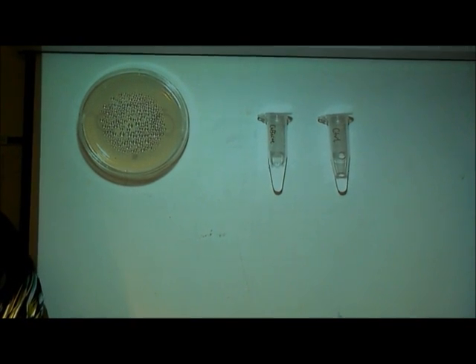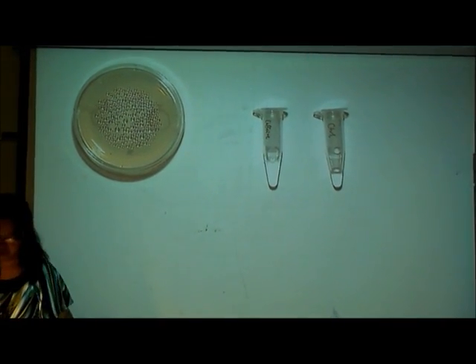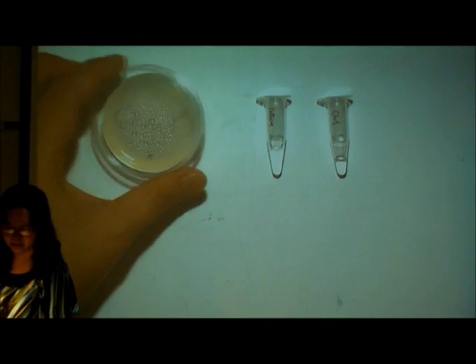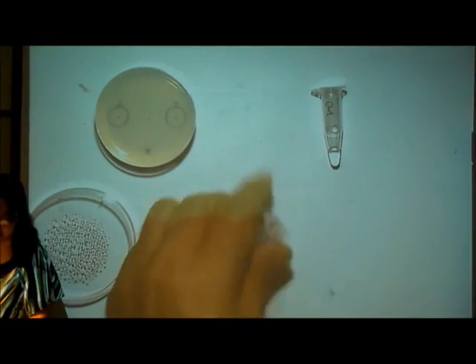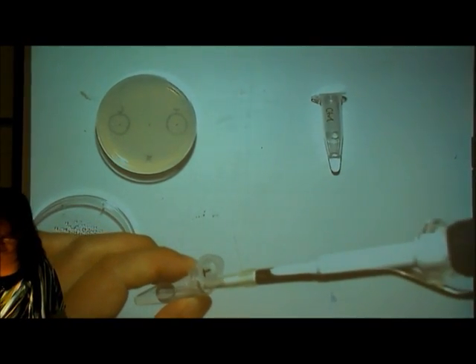Since this is a very small plate, you cannot spot more than 20 animals. I would suggest starting with 15 microliters of liquid for each spot.